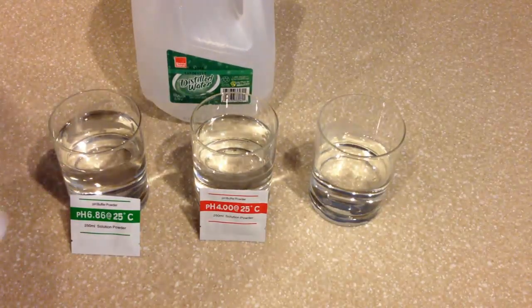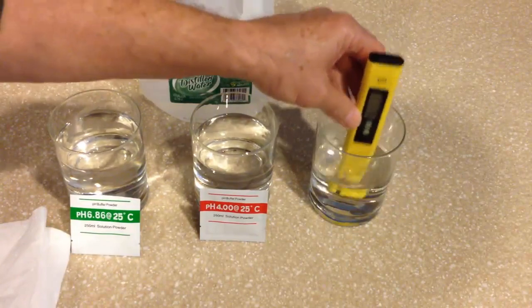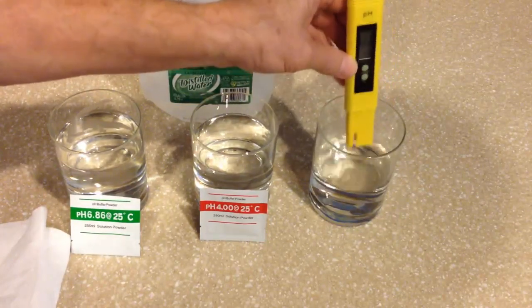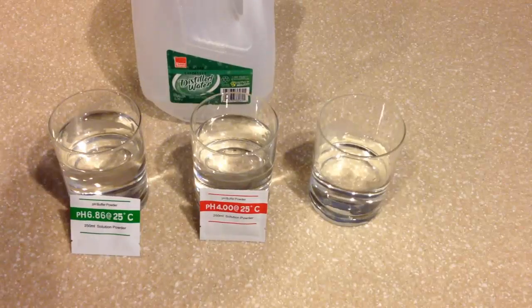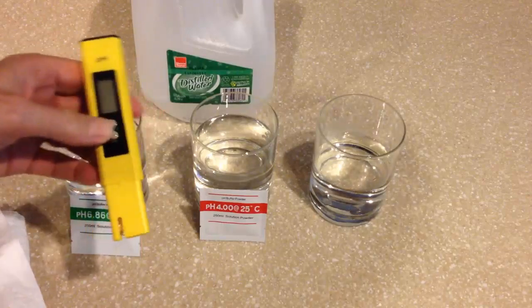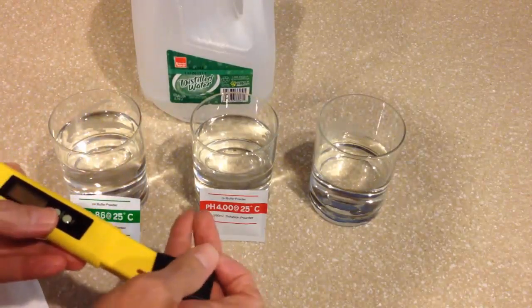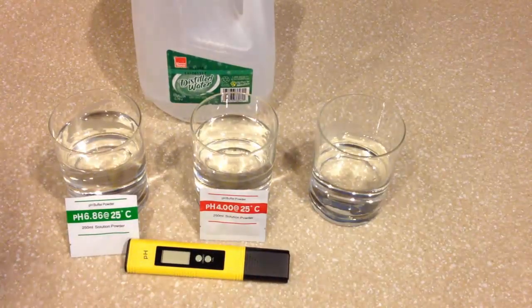It doesn't require a screwdriver, it doesn't require any tools at all, and it's completely one-hand push-button easy. That's the reason I like the Ryzentech digital pH meter. We're simply going to turn it off, replace its protective cap, and we're done. That simple.